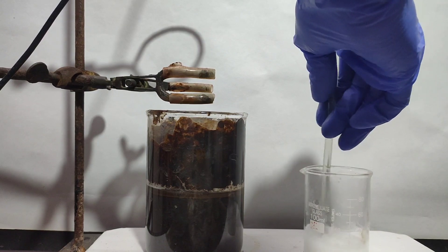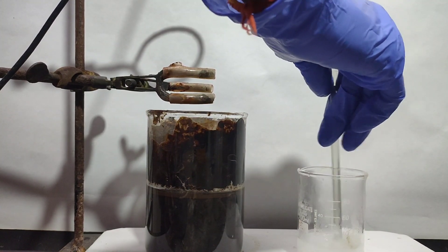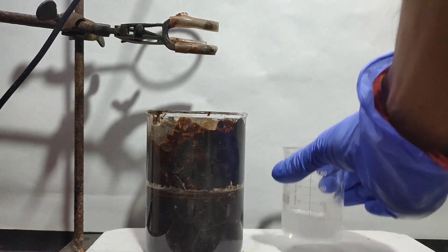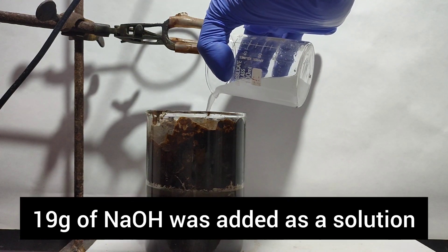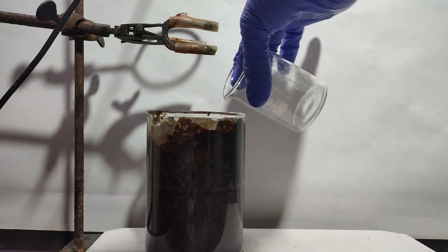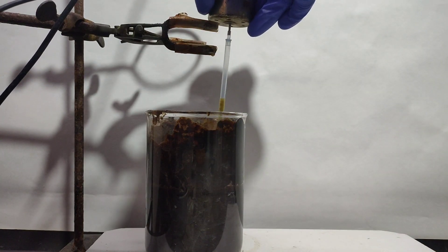Now we have to convert chromium hydroxide into sodium chromate, that is oxidizing chromium from +3 oxidation state to +6 oxidation state. For that to this slurry I am adding sodium hydroxide solution, which is prepared by dissolving 19 gram of sodium hydroxide in 20 to 30 ml water.